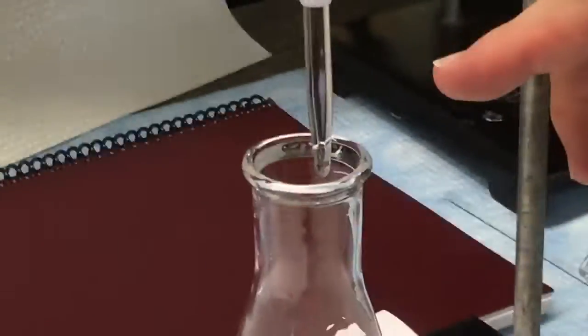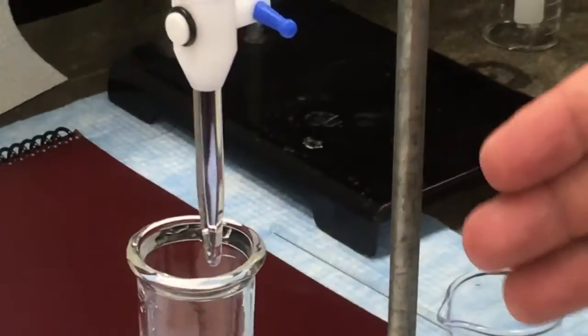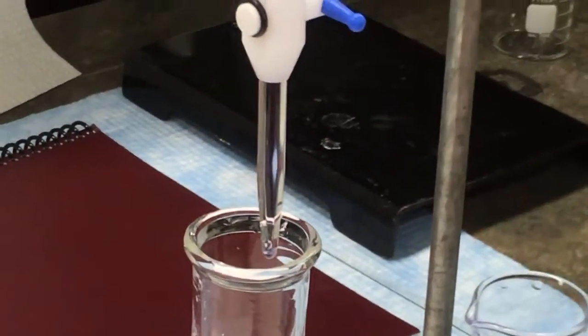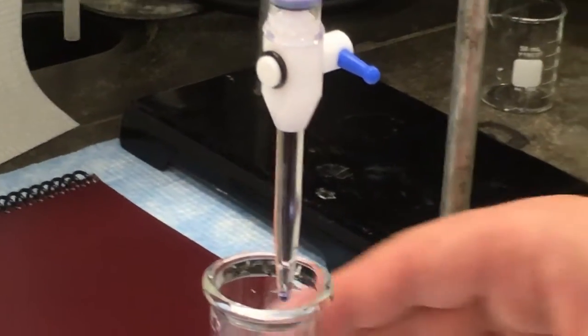And you can see the tip is now filled. It may be hard to see, but there is solution in it now. There are no bubbles or anything. There's no leaking going on. This is how it's supposed to look. So you would load the tip that way.